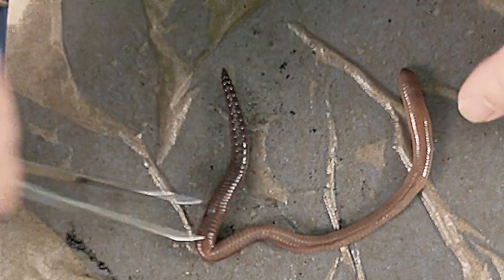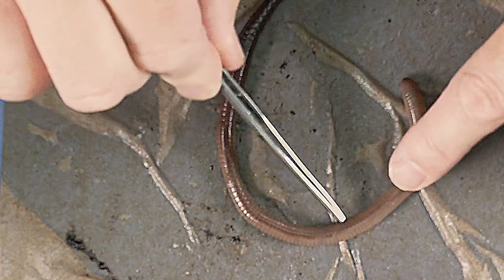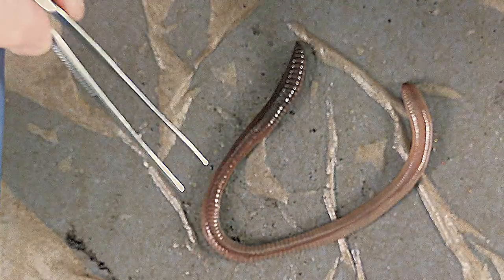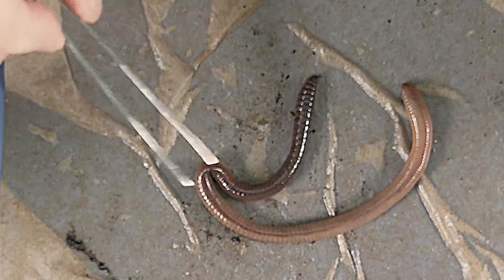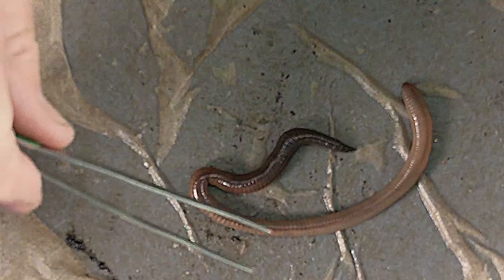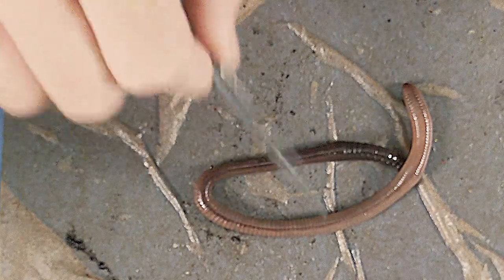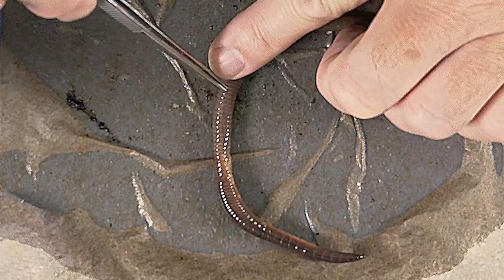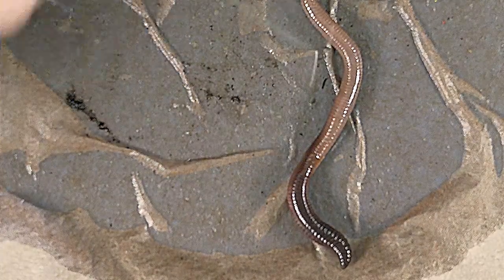If you were doing this you could see the dorsal blood vessel and actually see blood being pumped along it. Interestingly, if I filled a dish with water and added a little caffeine — a stimulant — you would see the pulses of blood along the dorsal vessel get faster. If I added a little alcohol, that would absorb into the worm quickly and the blood pulses would slow. So stimulants and depressants affect blood movement through the dorsal vessel. There's also a ventral vessel — you can actually see it quite nicely — carrying blood the other direction.